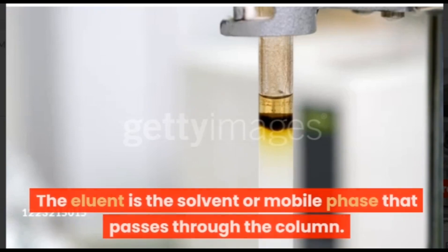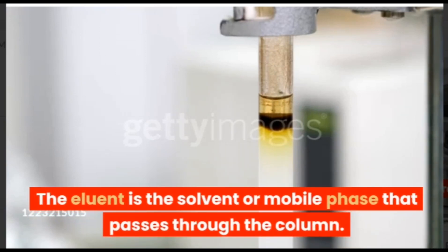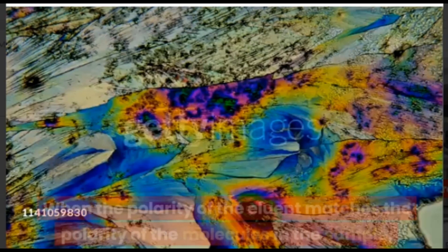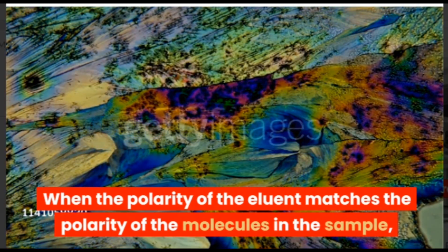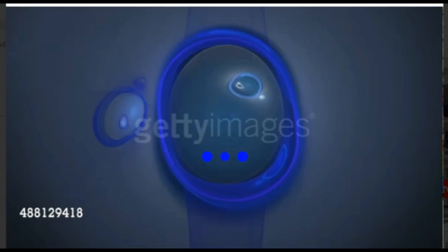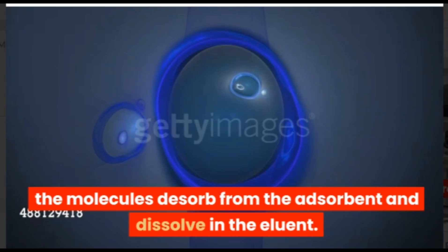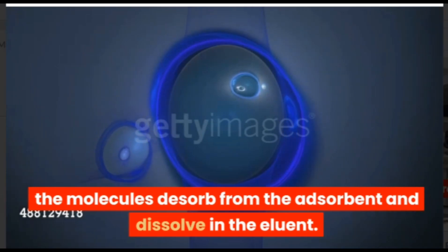The eluent is the solvent or mobile phase that passes through the column. When the polarity of the eluent matches the polarity of the molecules in the sample, the molecules desorb from the adsorbent and dissolve in the eluent.